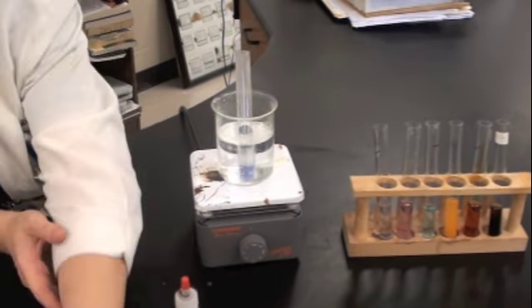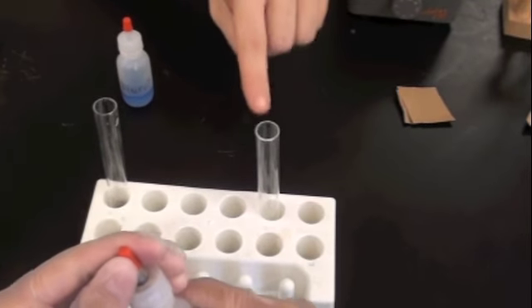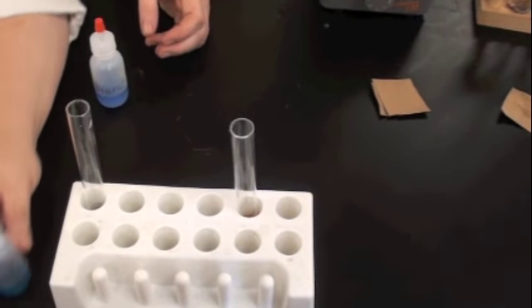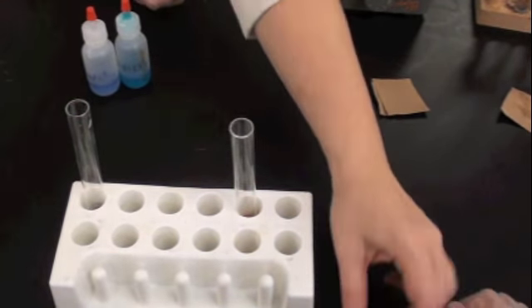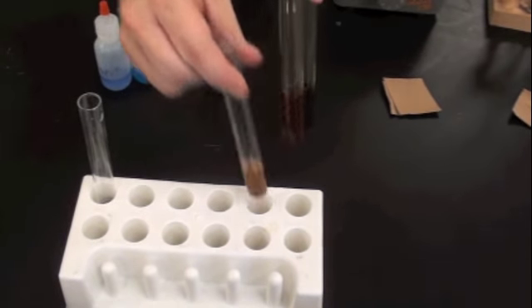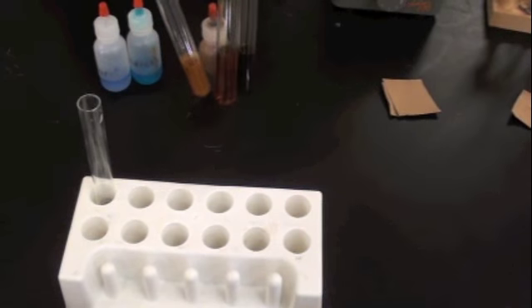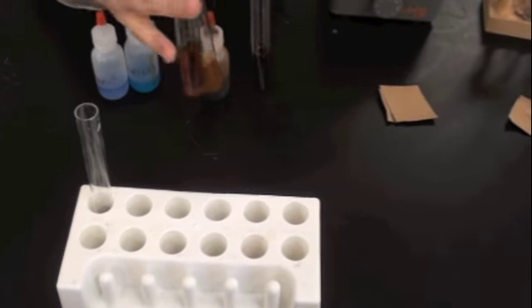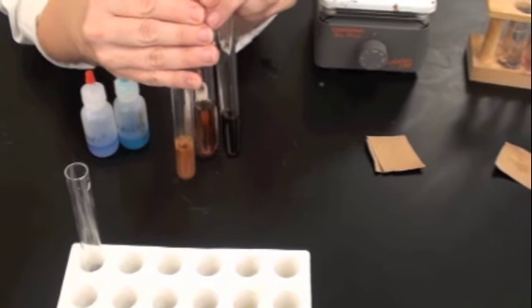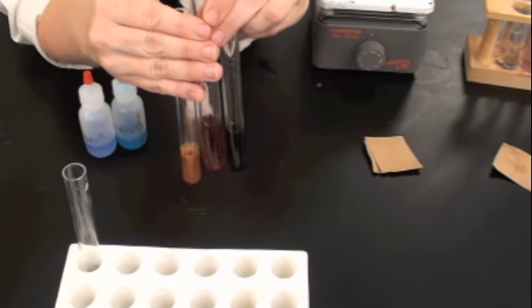Here we're going to do the starch test. If you will, put, let's just go 5 drops into here. Great. Okay. Brown is a negative reaction. Black, jet black, and thick is a positive reaction. So, offhand, I would say, with no black precipitate at all, that this is a negative starch reaction. Wouldn't you agree, Stu?